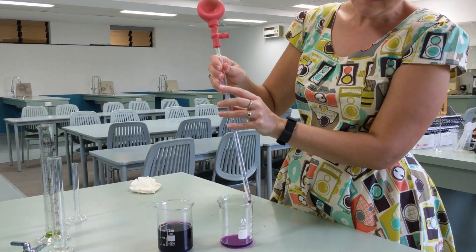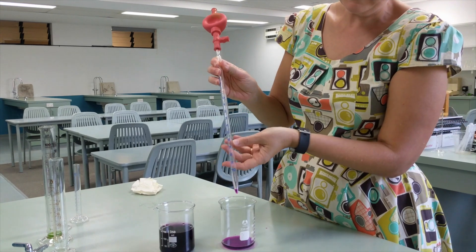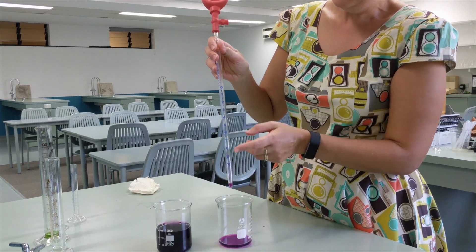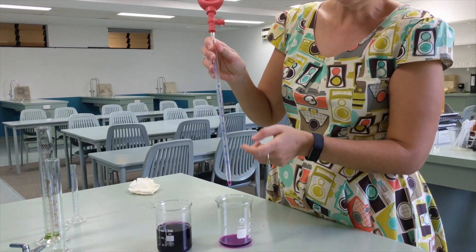You'll notice that there is always going to be a small amount of liquid left over, stuck in the bottom of the pipette. That's fine, that's okay. These volumes are calibrated to take that into account.